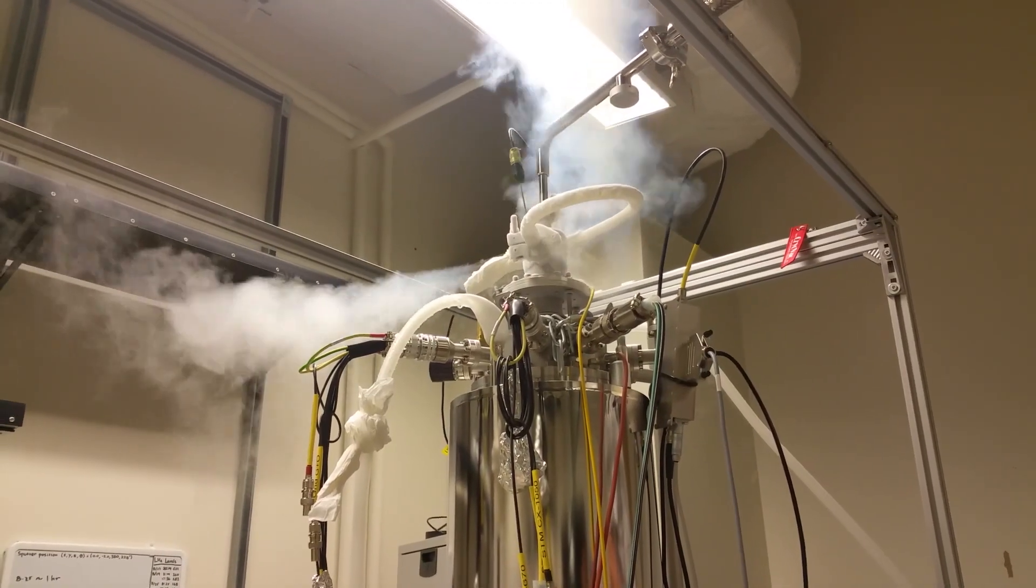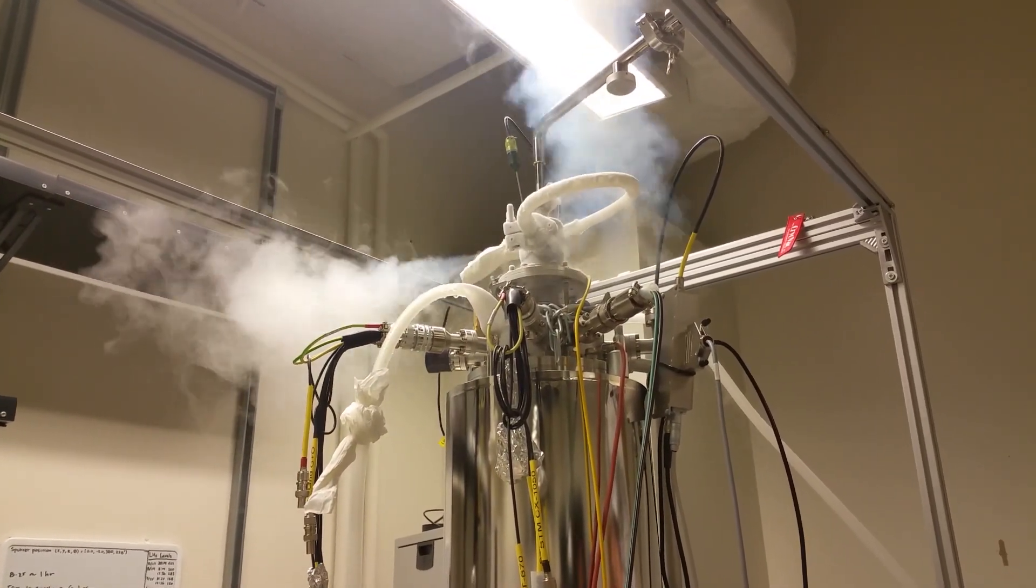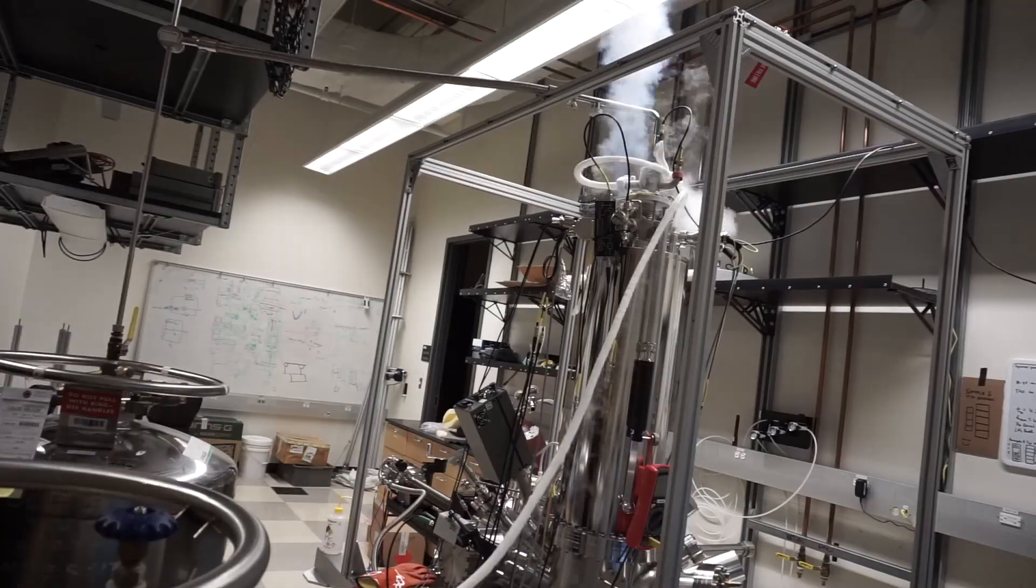It's a double fill. We're filling both helium and nitrogen in cryostat.